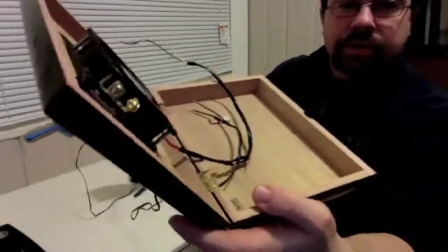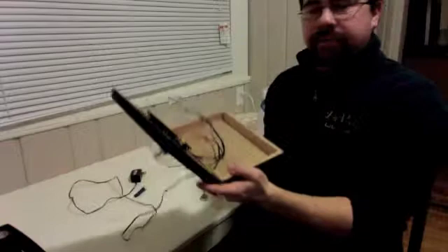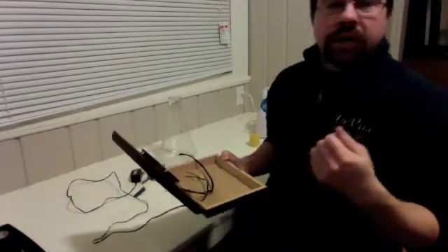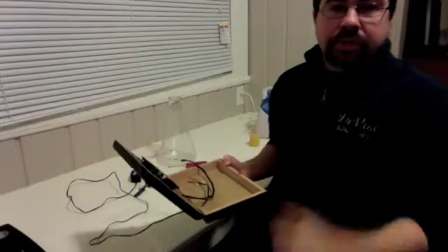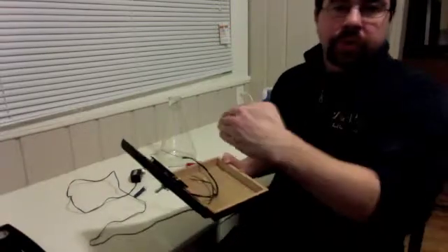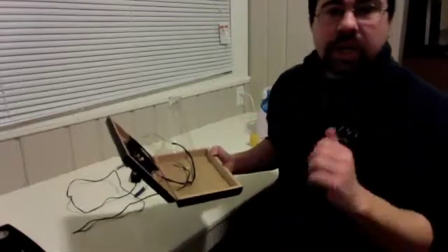And all you're going to do is cut one of the wires in half, not the ground, the other 2, and then put it on those 2 screws instead of it just being one wire. You cut it in half and attach it to the 2 screws. And I will show you what that looks like in just a second here.